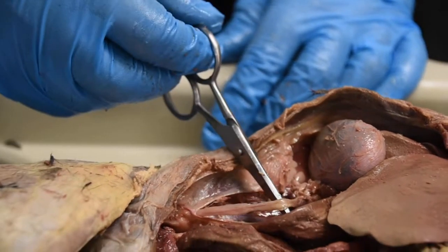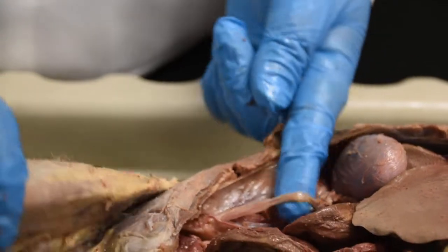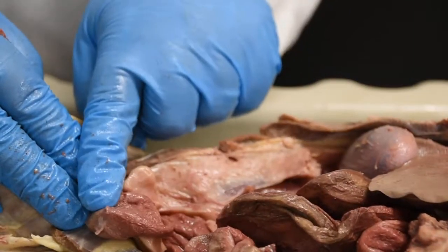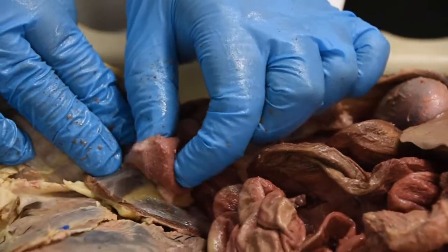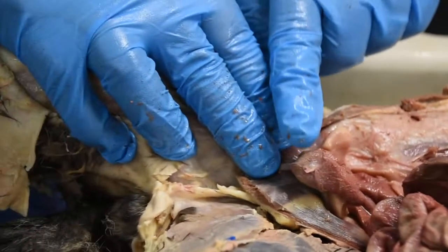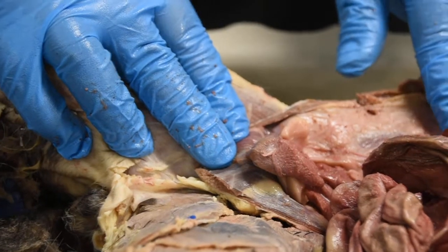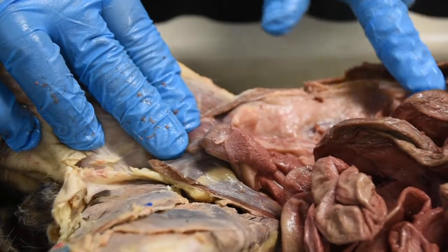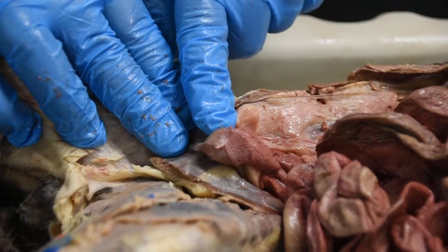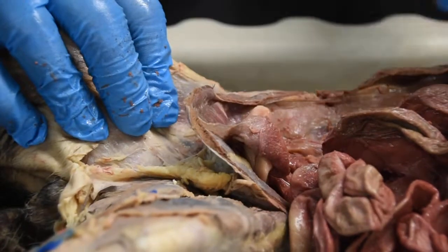So here's my ureter. If I track my ureter, which is collecting urine, I can work my way all the way to this little sac you see right here. This sac is tucked into the abdominal pelvic region and is referred to as your urinary bladder. So you have your kidney, and from the kidney to the urinary bladder is your ureter. And then your storage of the urine is inside the little bladder here.